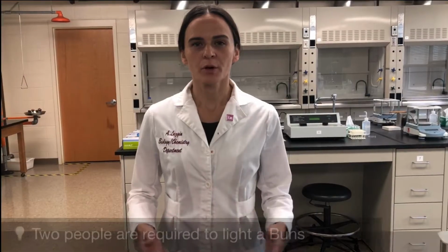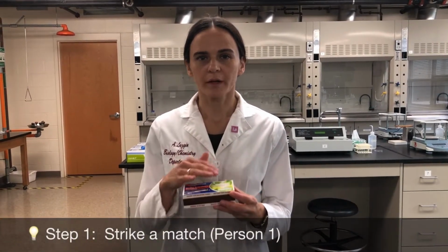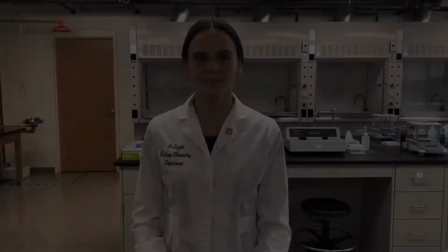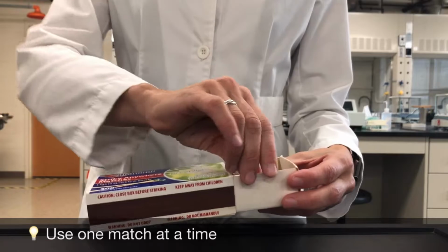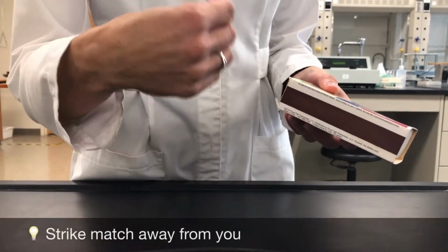When lighting a Bunsen burner, it requires two people. So in the lab, you'll be either working with myself or with a lab aide. So the first step would be to light a match, and the second step would be to turn on the gas. You would then ignite the Bunsen burner. When striking a match, you remove one of them. You want to make sure you close the box so you don't ignite the entire box of matches. So you hold a match, you strike it away from you.